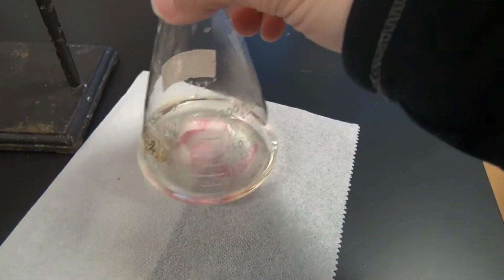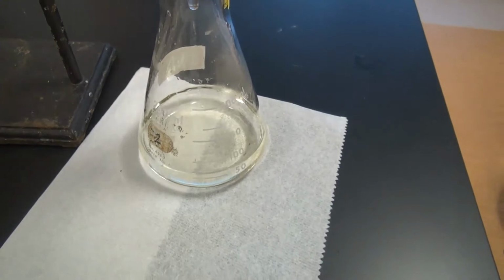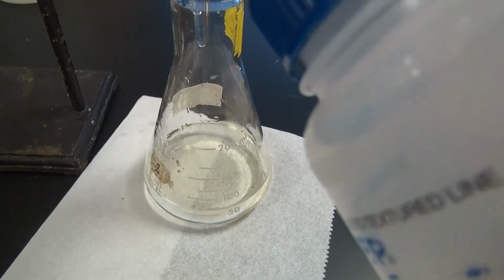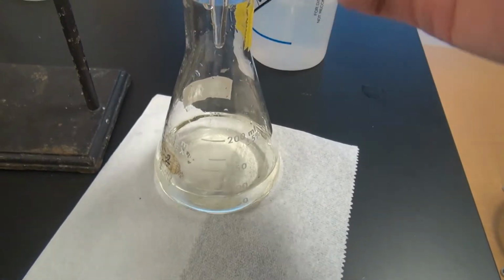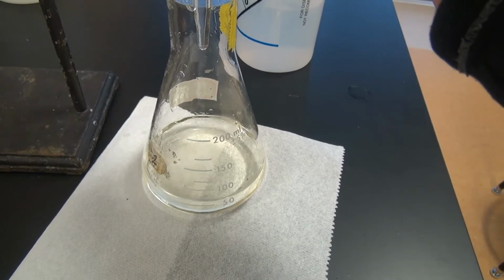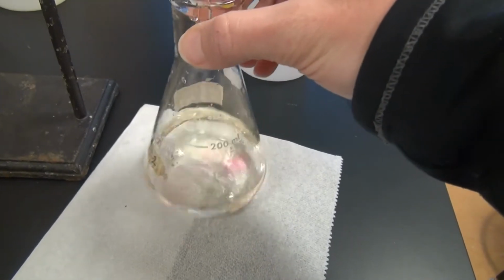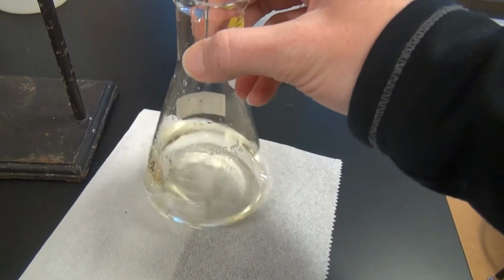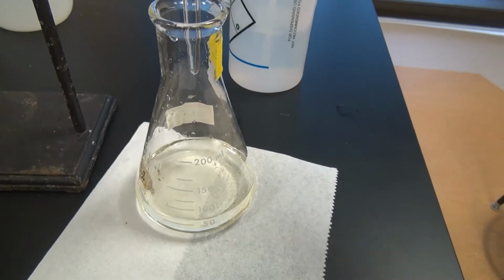Go ahead and stop it for a minute, and I'm going to wash down the sides. Start recording drop by drop.